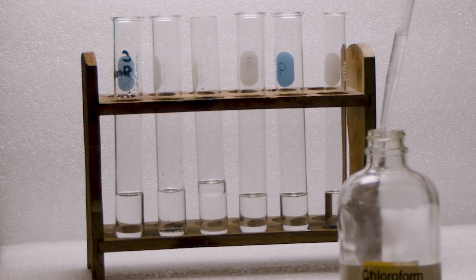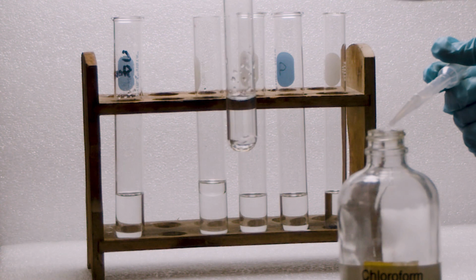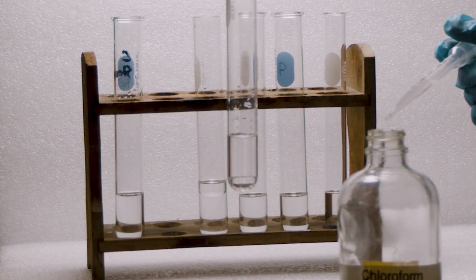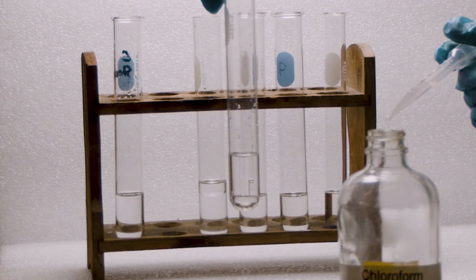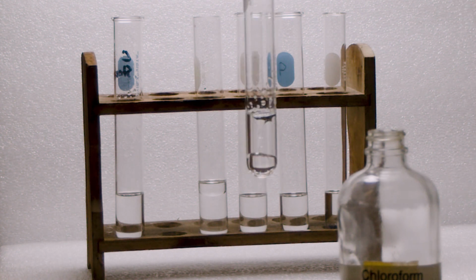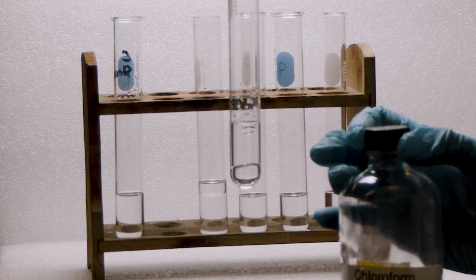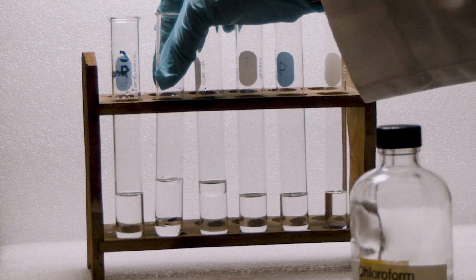So this is my chloroform. You may wonder which one is where, whether the top is water or chloroform. So what I'm going to do is add chloroform, and if it stays on the top, my top layer increases. So let's add it. No, my bottom layer increases, right? So that means chloroform density is higher than water. So water remains on the top and chloroform goes to the bottom.